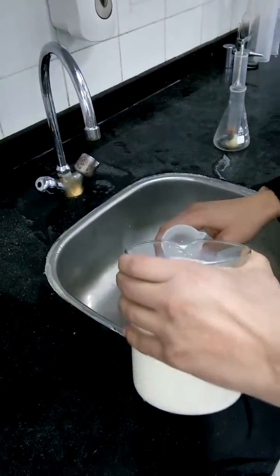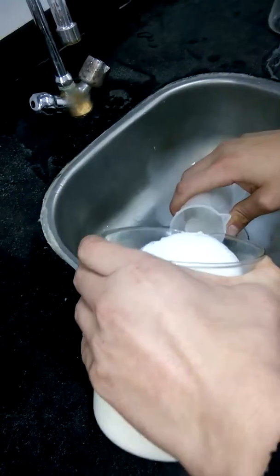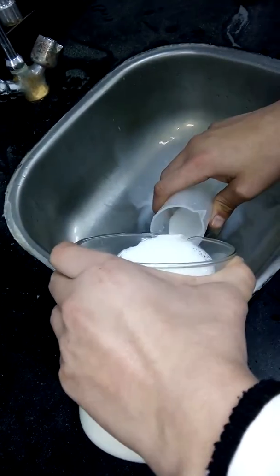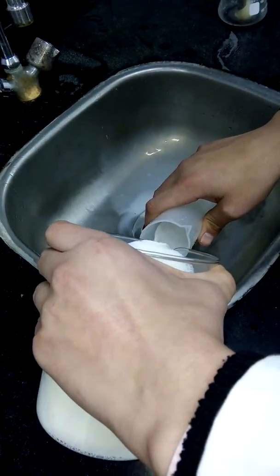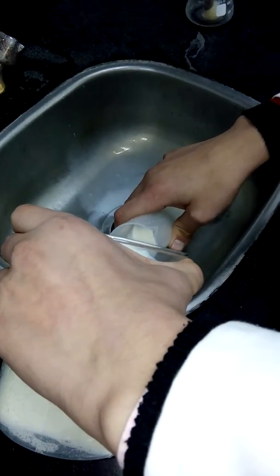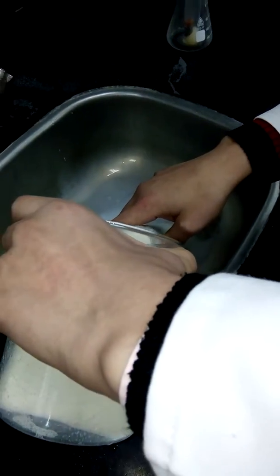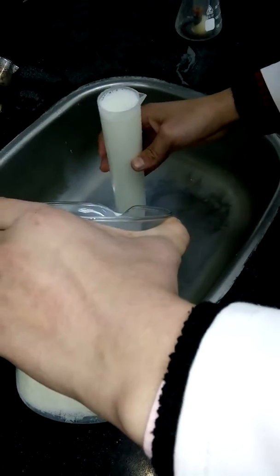Now I put our sample in carefully, because I don't want any air bubbles, and if there are any I have to remove them.